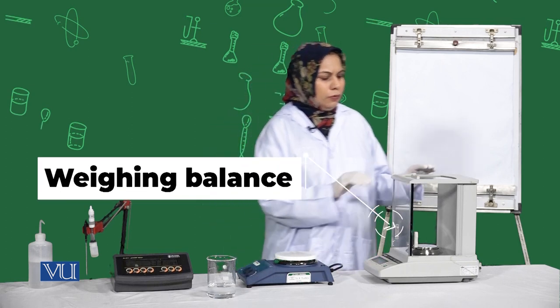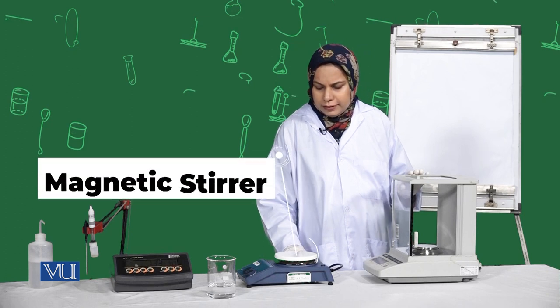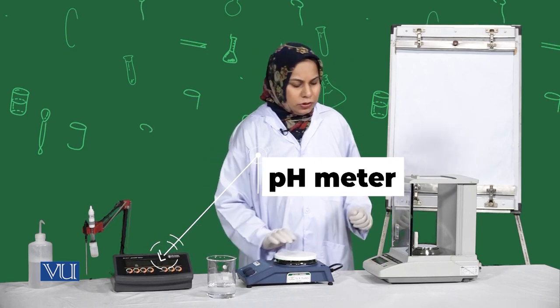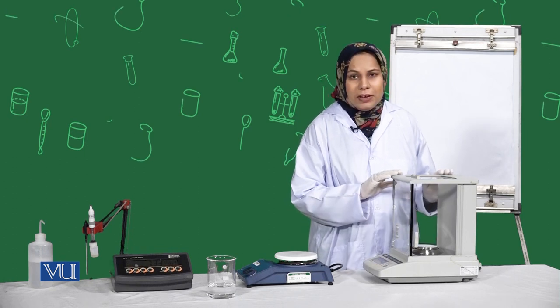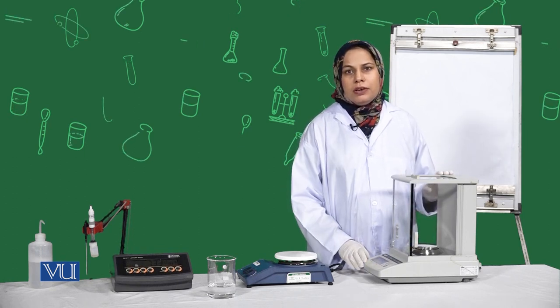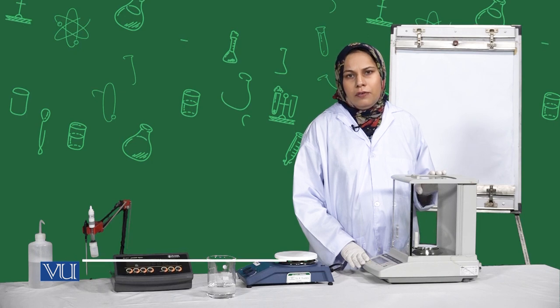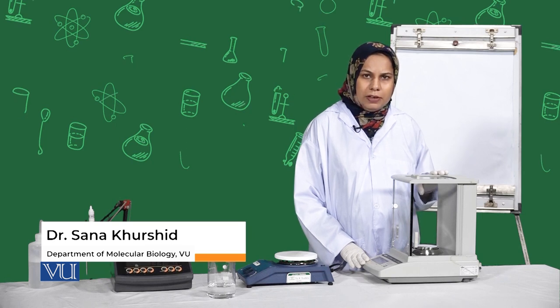Dear students, most commonly for preparation of solutions, whether stock or working, we need instruments like weighing balance, magnetic stirrer or hot plate, and pH meter. Let me introduce you to these instruments. Weighing balance is an instrument used to measure the mass of an object. There are different types, but usually they are of two types: analytical and precision weighing balance. They vary in the quantity they can measure as well as in precision.